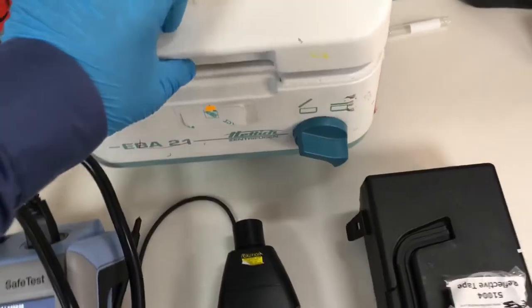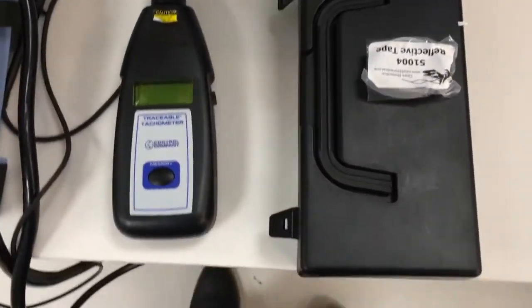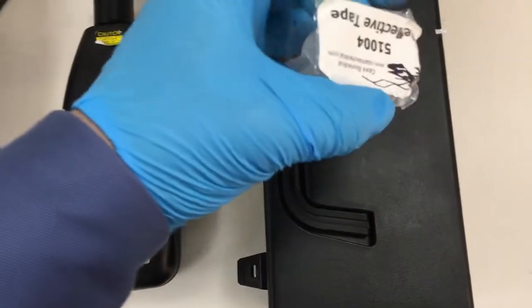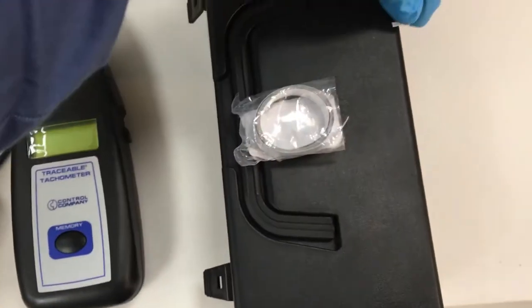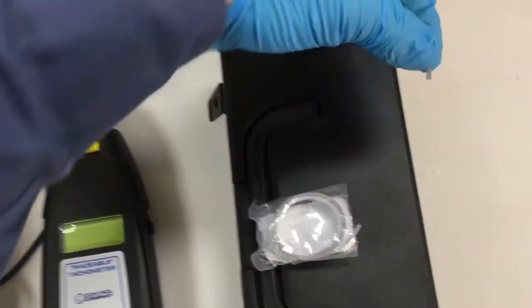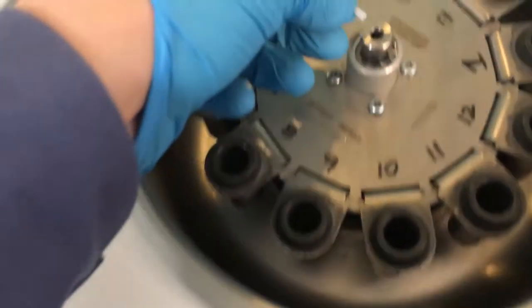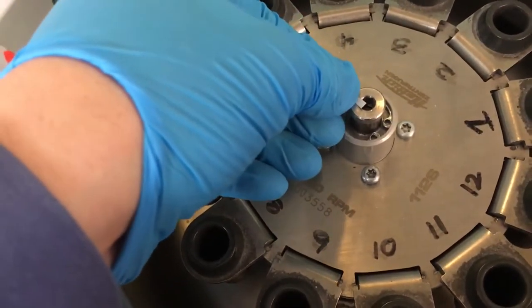We need to use special reflective tape. We need to just take a little piece and put it on this side.